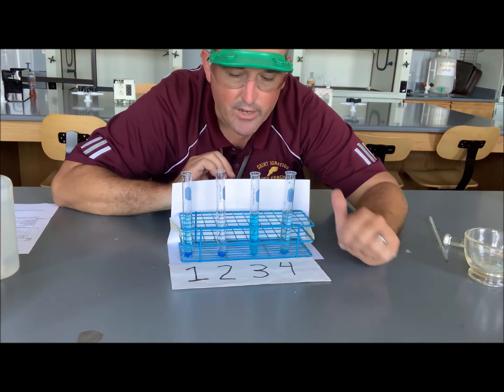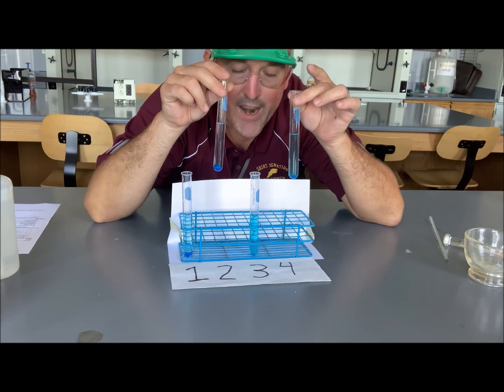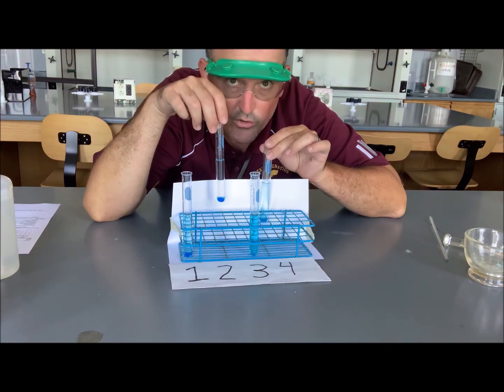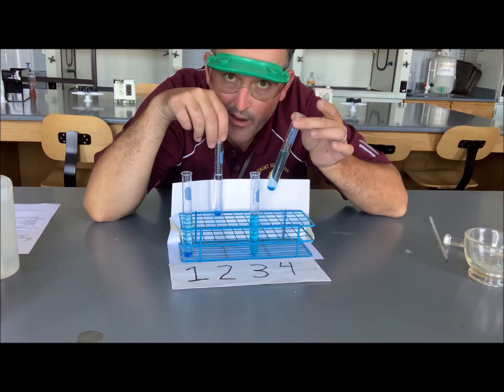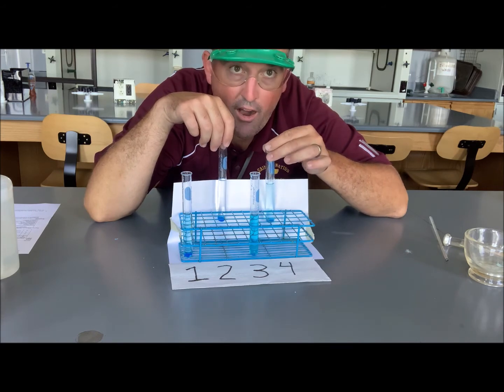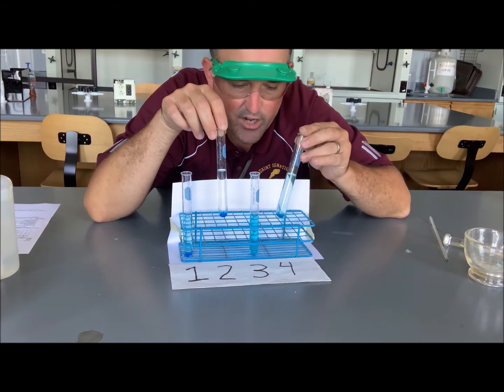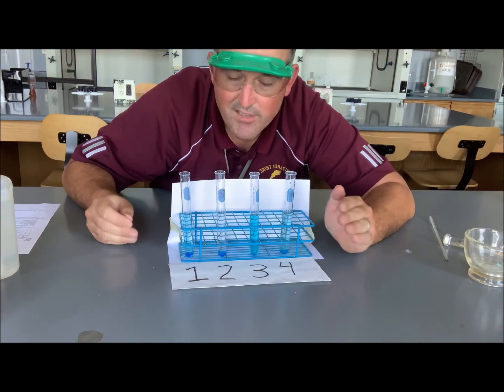Now what about crushing? Let's compare the 2 test tubes that were not swirled. In test tube 2, we have a tube that was not swirled and had a full-size crystal. In test tube 4, we have a crystal that was not swirled and was crushed up. So of these two, which one has more blue in it? Test tube 4. So crushing the particle, or thereby increasing the surface area, helps get things dissolved.